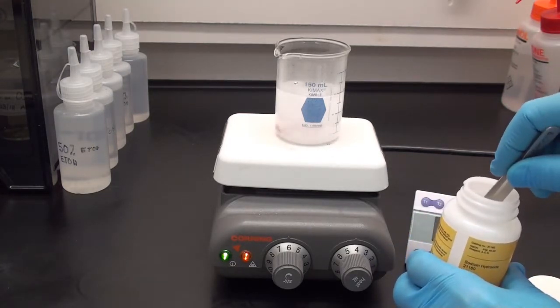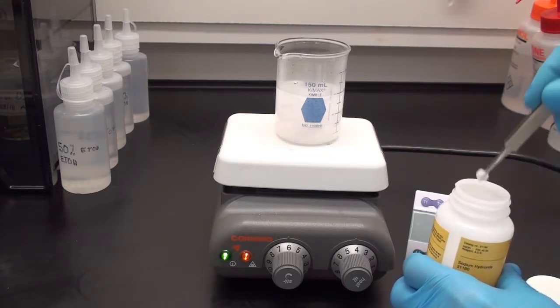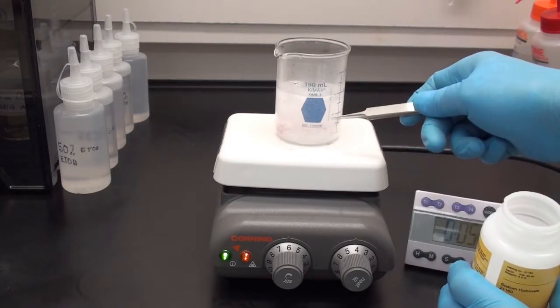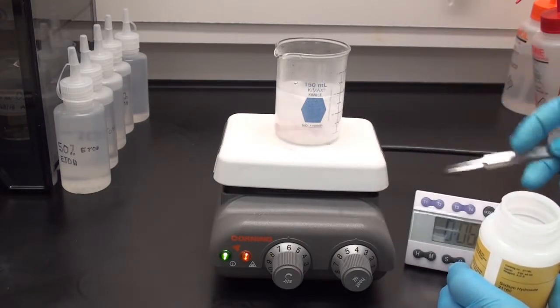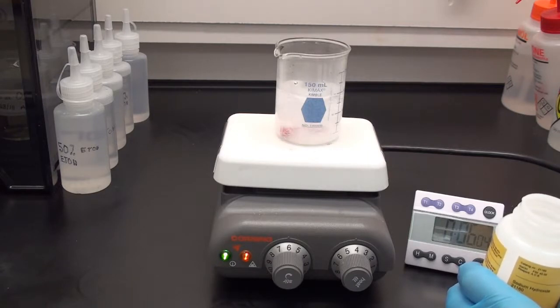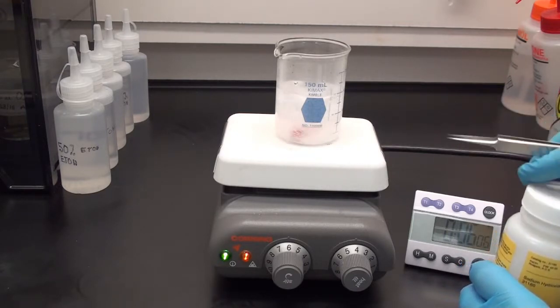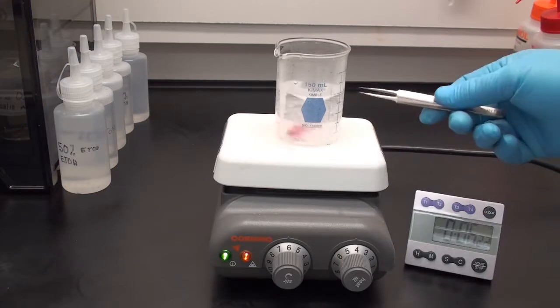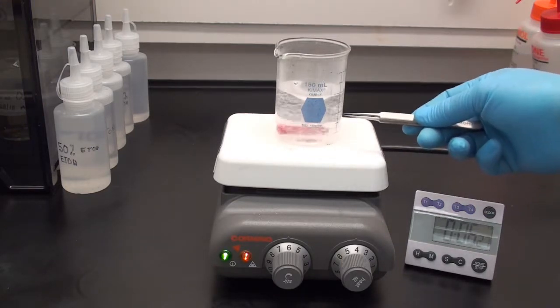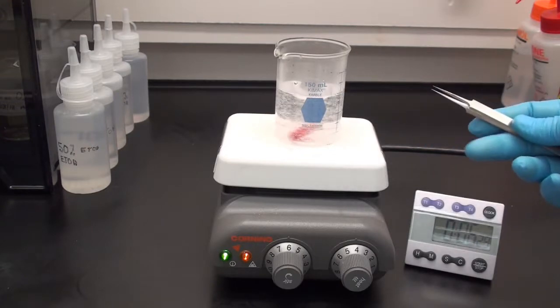It's still cloudy so I still need to add one more pellet of sodium hydroxide. I'm going to let that mix. I'm not going to get too carried away and we can see it's starting to clear already. It's only been 6 minutes in terms of the mixing. The solution is already starting to clear.